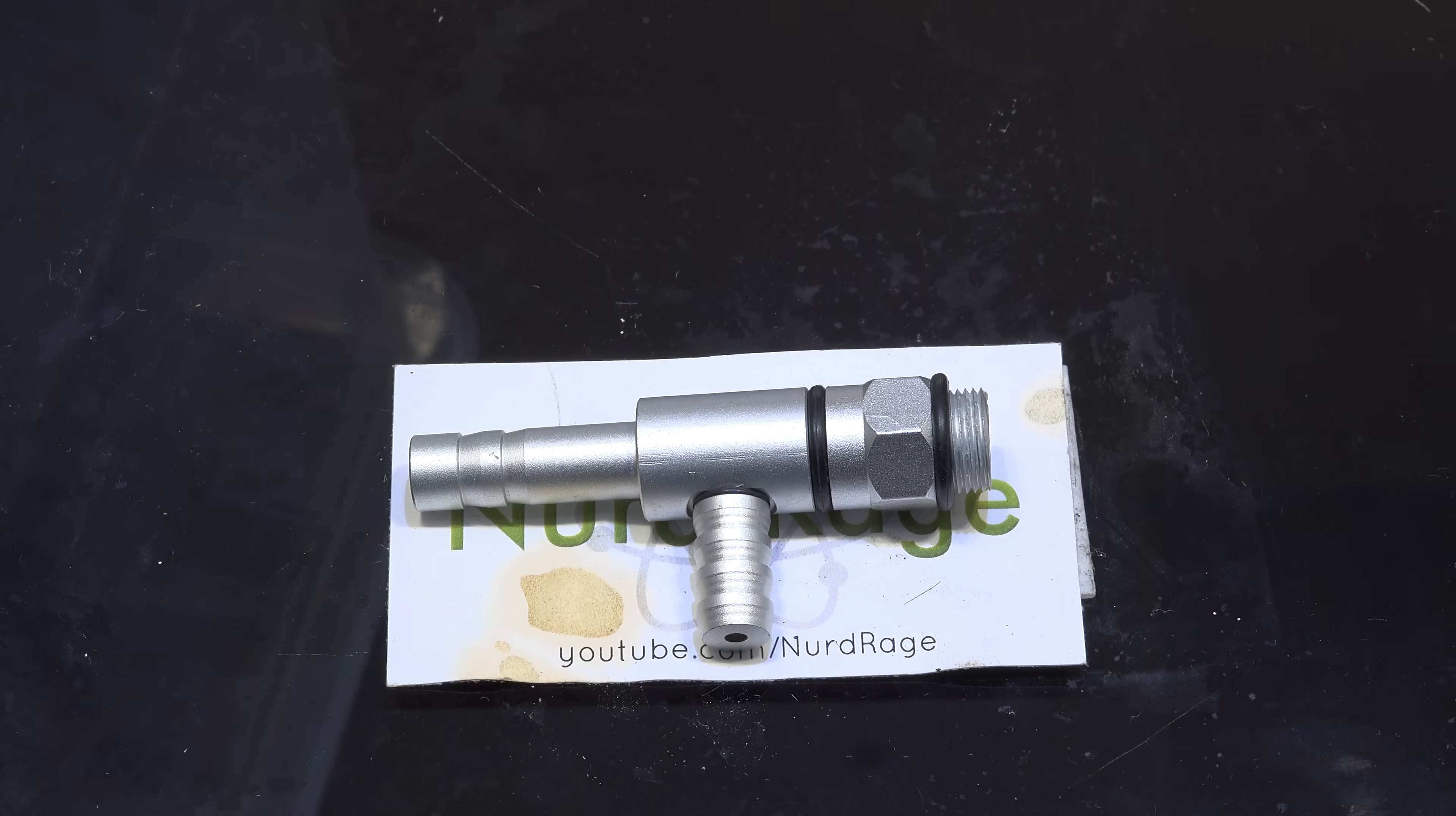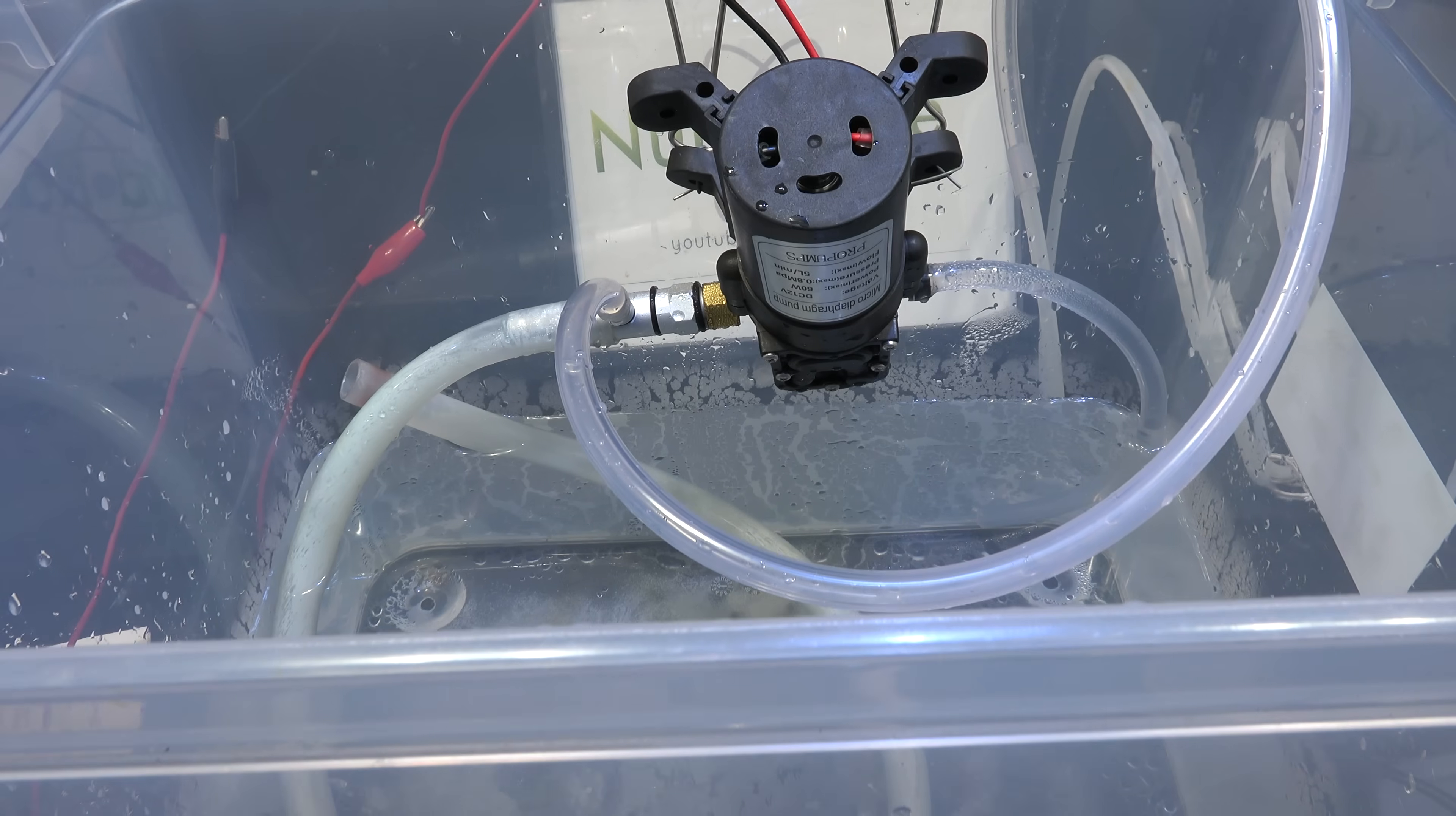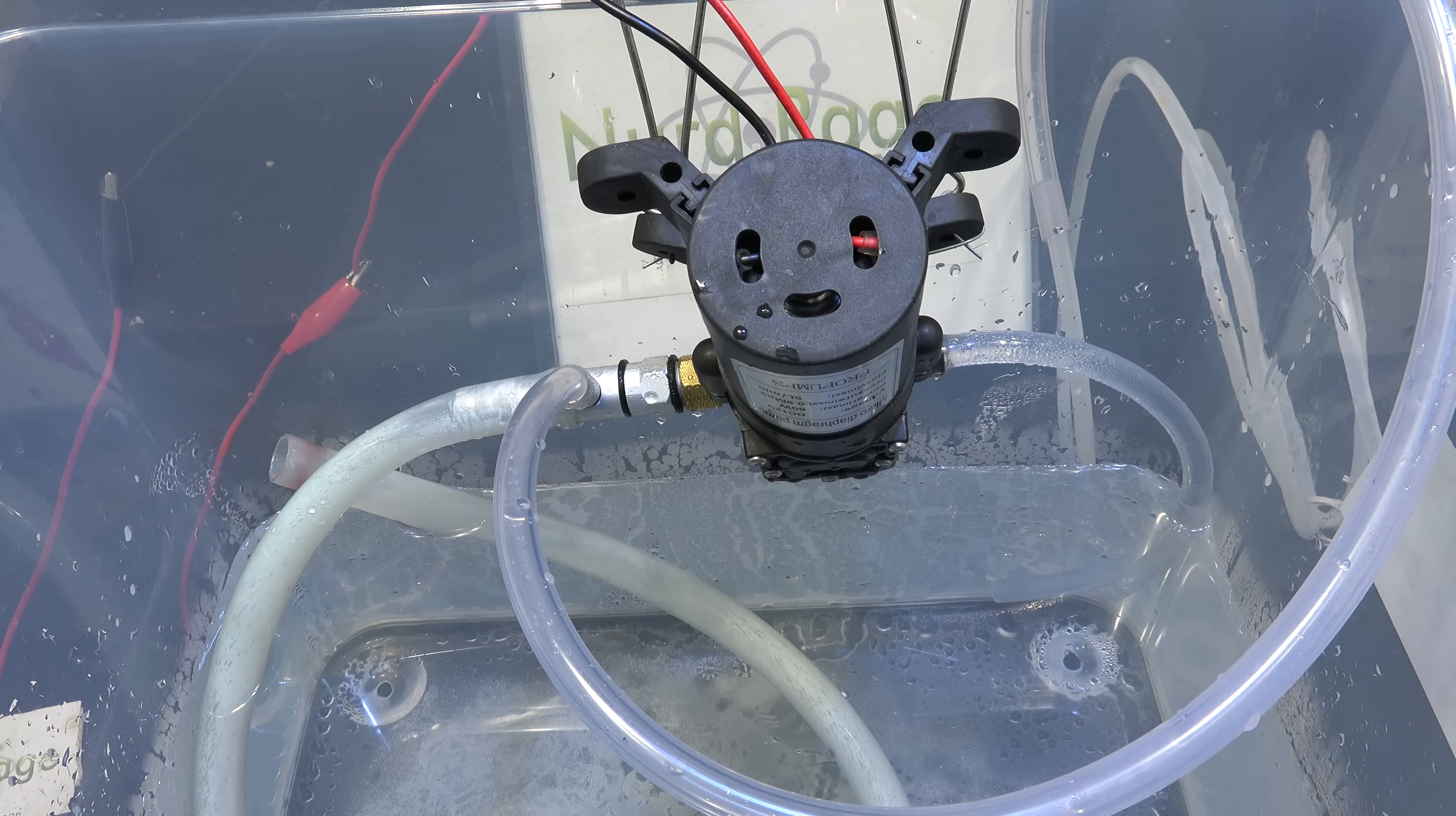To use one you're going to need a high pressure water pump to feed it. Here's my setup. Now originally most amateurs and even most professionals just connected the aspirator to their faucet and ran water through it. Obviously this was tremendously wasteful in terms of water going down the sink and can be blatantly illegal depending on your local laws since the water is now mixed with possibly very toxic chemicals.